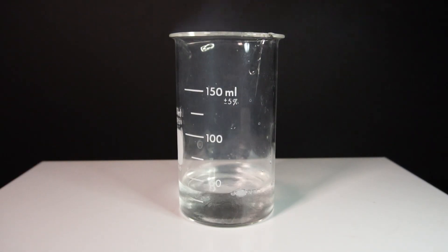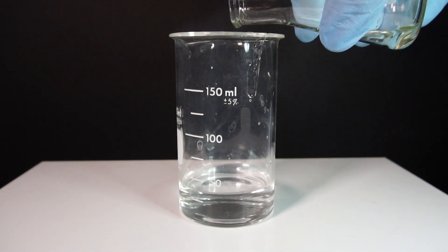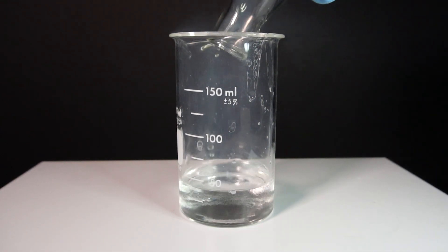In the future, I have an upcoming project in which I need ammonium chloride, so I decided to make it. However, this method is not cost effective at all, and it's more for fun than anything.